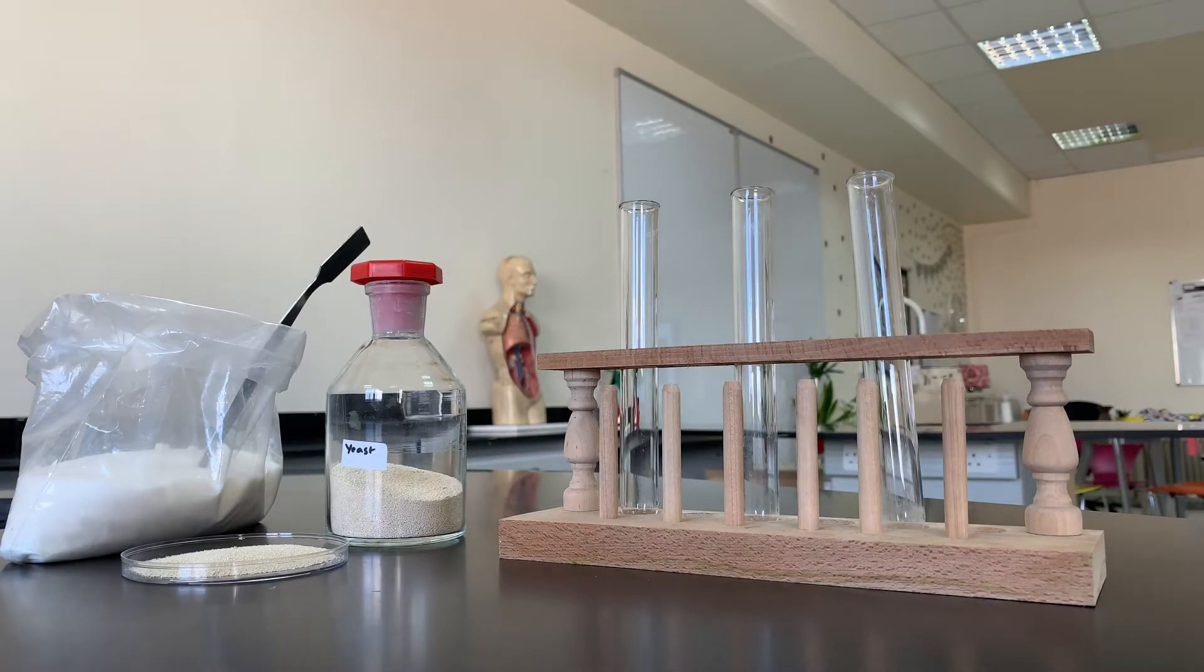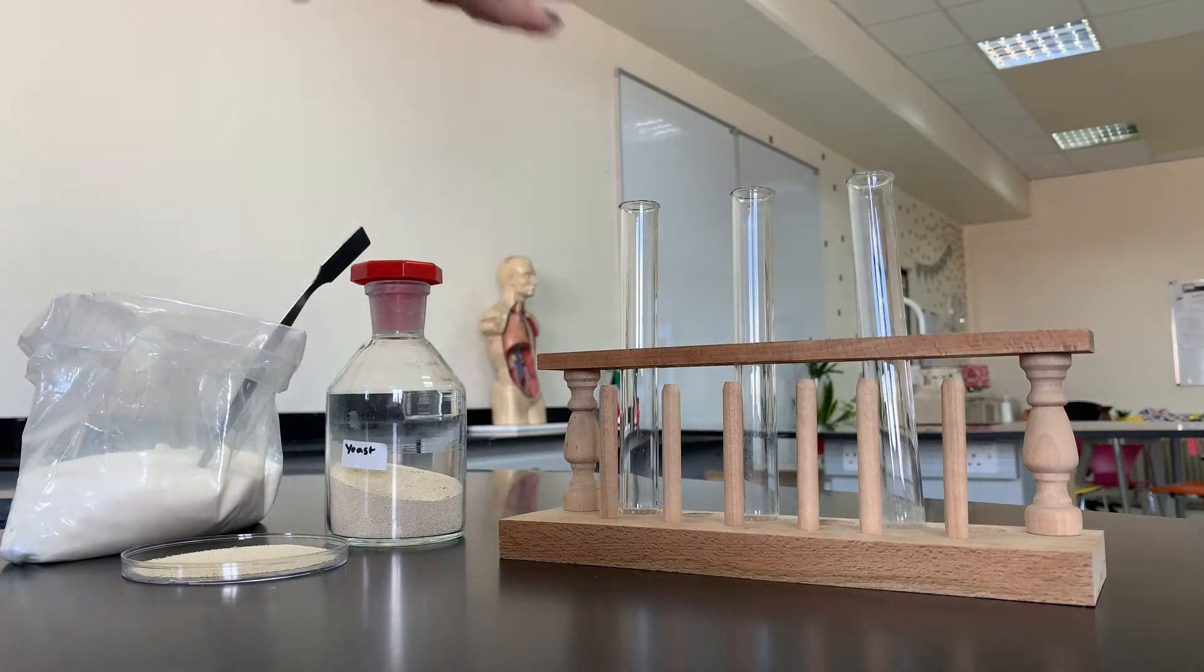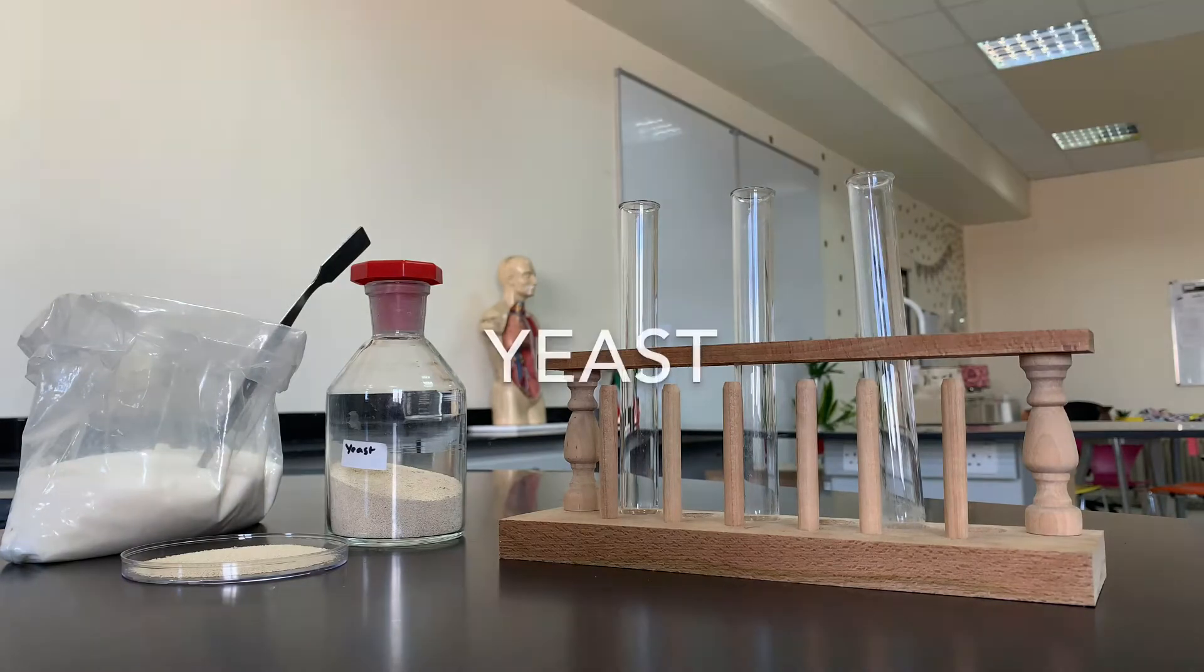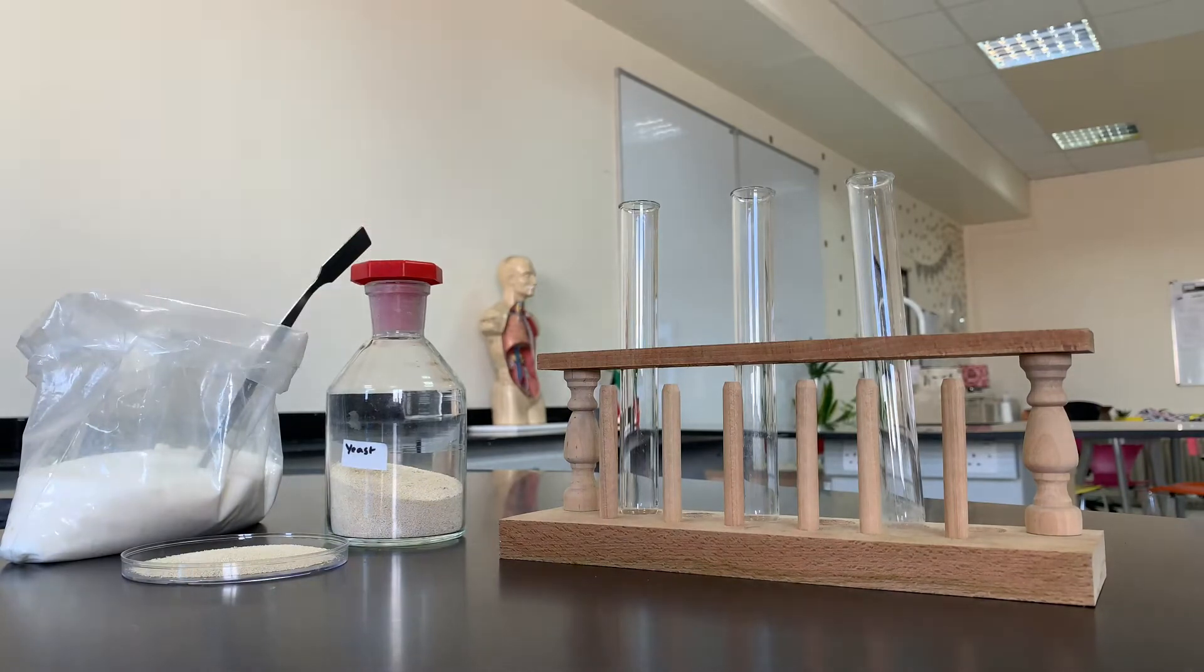In this experiment we're going to be investigating cellular respiration, often known as fermentation. Here I have three different test tubes, yeast, and sugar. Yeast is a microorganism that uses the process of fermentation in order to make energy.